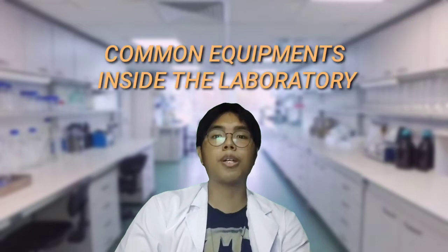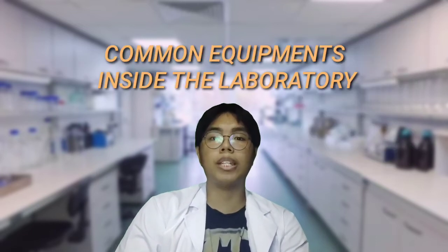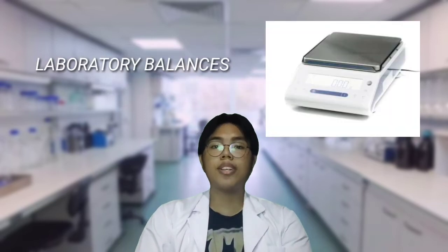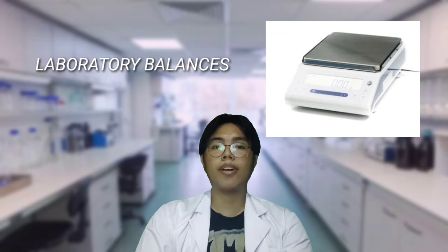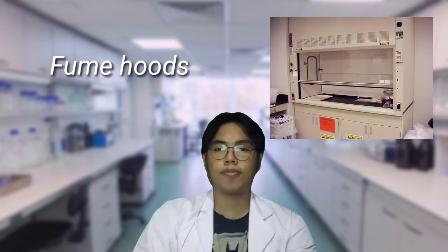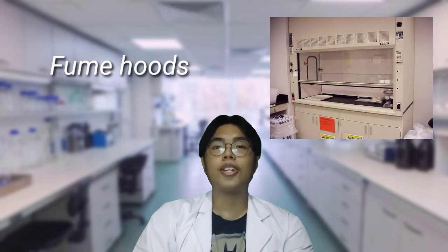Now, here are some of the common equipment that we're working with inside the laboratory. Balances. These are used for determining the mass of the reagents and the objects inside the laboratory. Spectrophotometers. These are used to measure a liquid sample's absorbance or transmittance. Fume hoods. These are used for ventilation of hazardous or harmful gases.